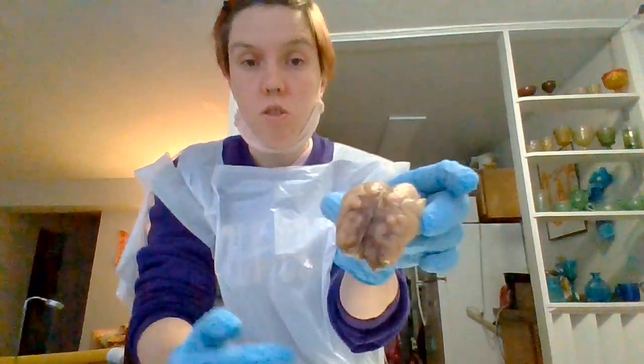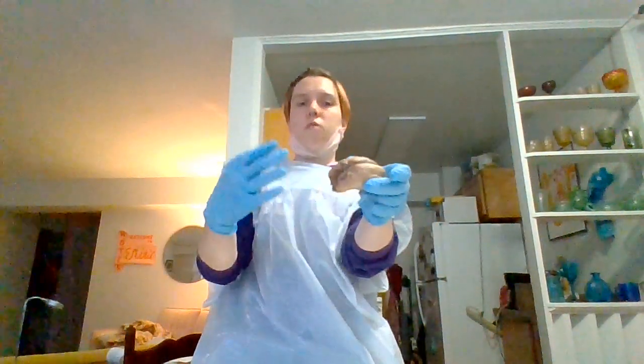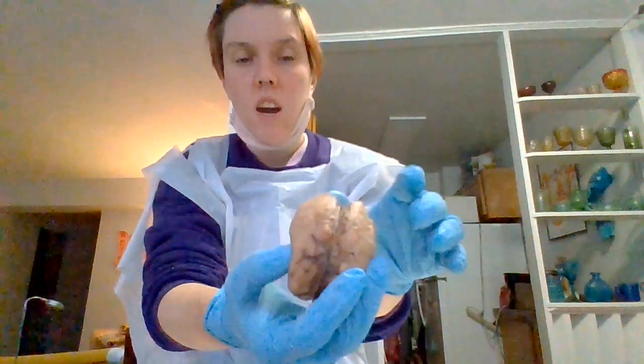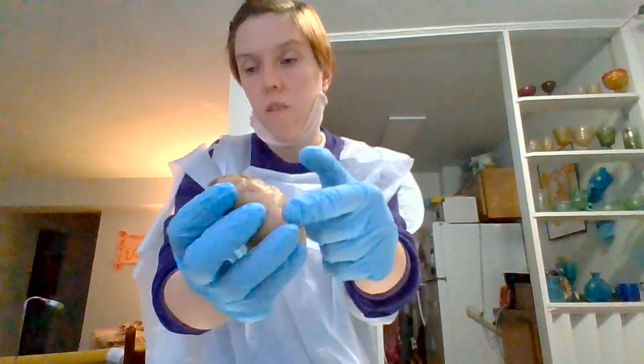And then one thing I want to show you as best as I can is that the brain has these, imagine how you think of a brain, right? People talk about the meme about having a smooth brain. You don't have a smooth brain. It has these protrusions called gyri, and the gyri have these dark ridges into the brain that are called sulci. So you can see them there, the sulci and the gyri.